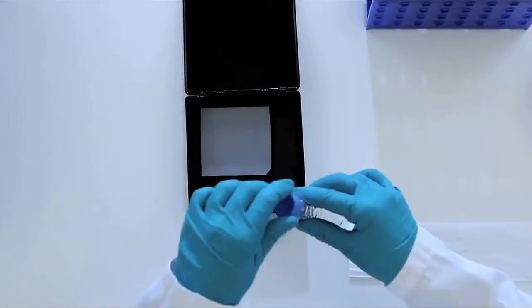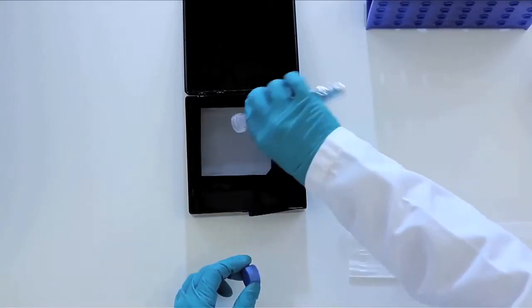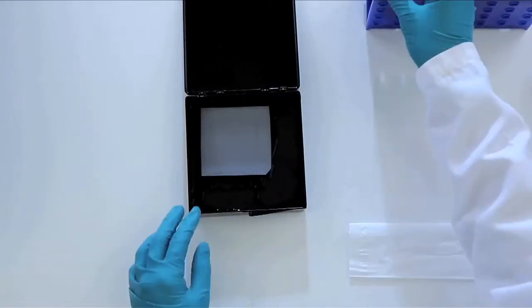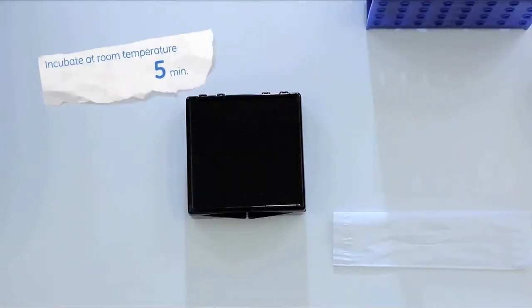Add the reagent to the membrane, making certain the entire membrane is covered. Incubate the membrane for 5 minutes at room temperature and in the dark if you choose.